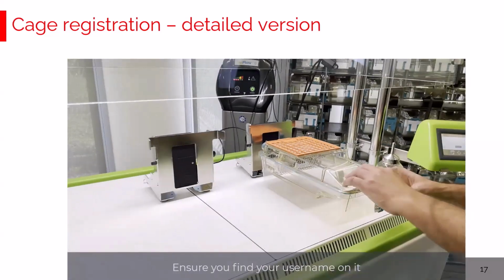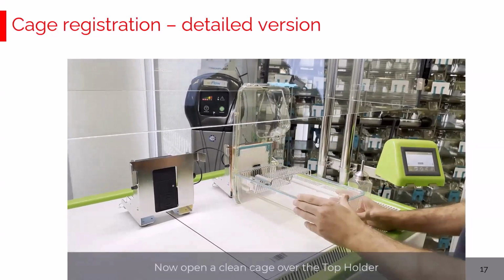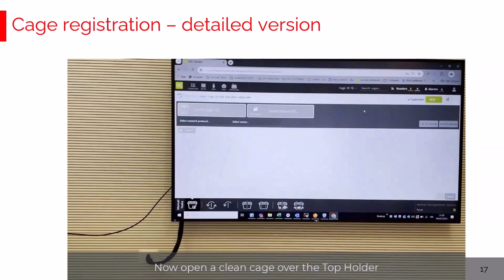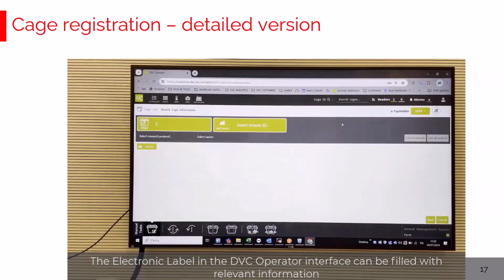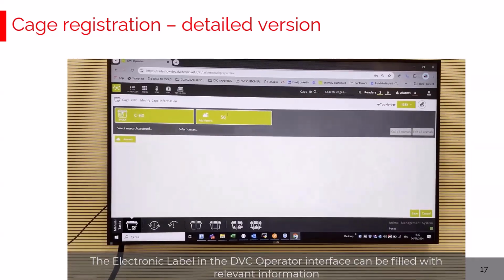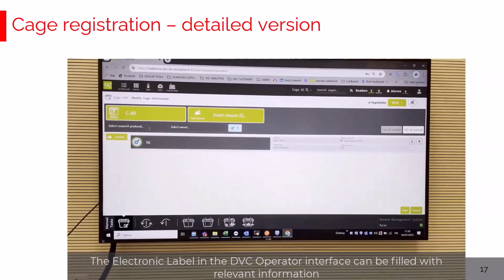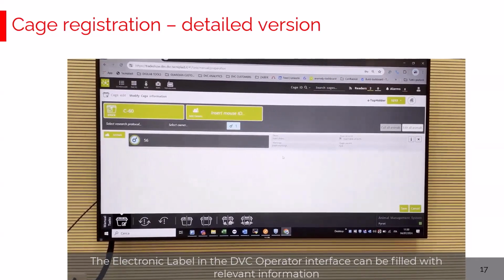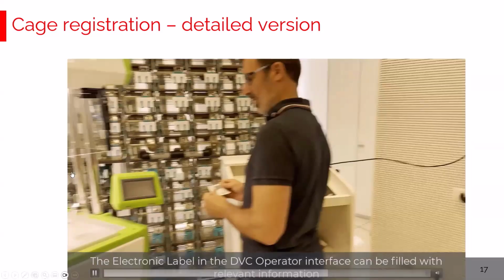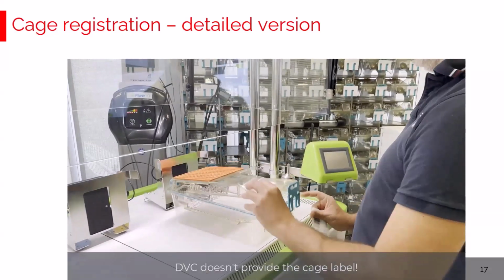And now finally, you can open the cage to be registered, simply moving the cage close to the reader, and the cage appears immediately also in the DVC Operator interface. And now, like before, it's time to register with the needed information: the cage ID, the ID of the animals, if any, sex, strain, date of birth, and so on. All this information is not really mandatory. It depends on you, as well as, by the way, the cage label. We don't provide any specific cage label, we simply follow your information.